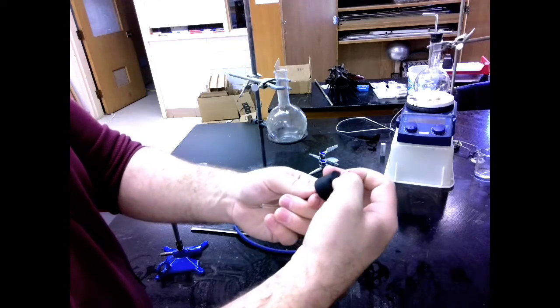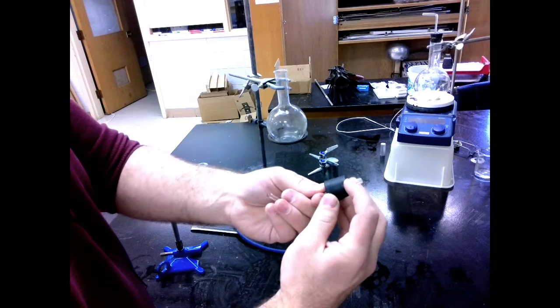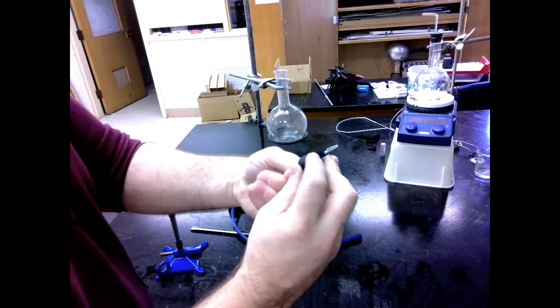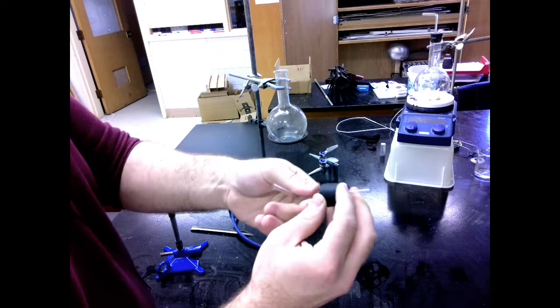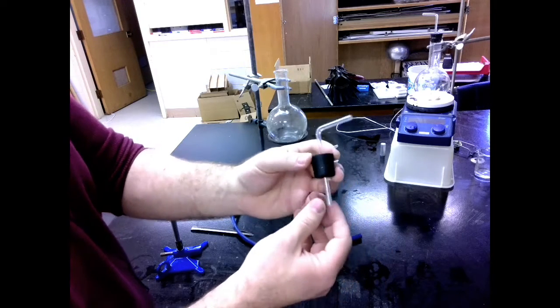When you're pushing it on, you should actually hold it here so that you can kind of spread the stopper apart. So that as it's going in, the stopper spreads open and allows it to move. There we go. Perfect.